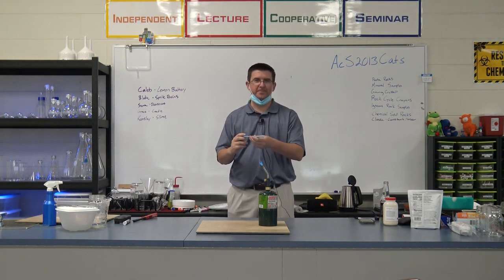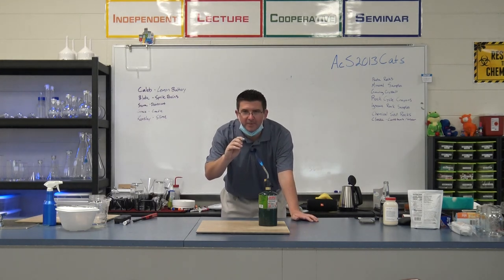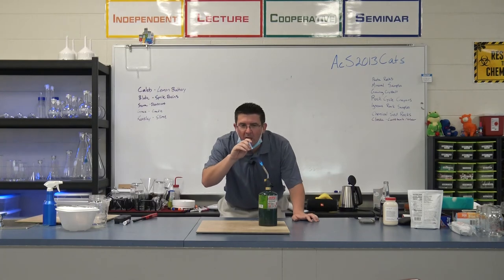Is everybody ready? All right, here we go. 5, 4, 3, 2, 1.